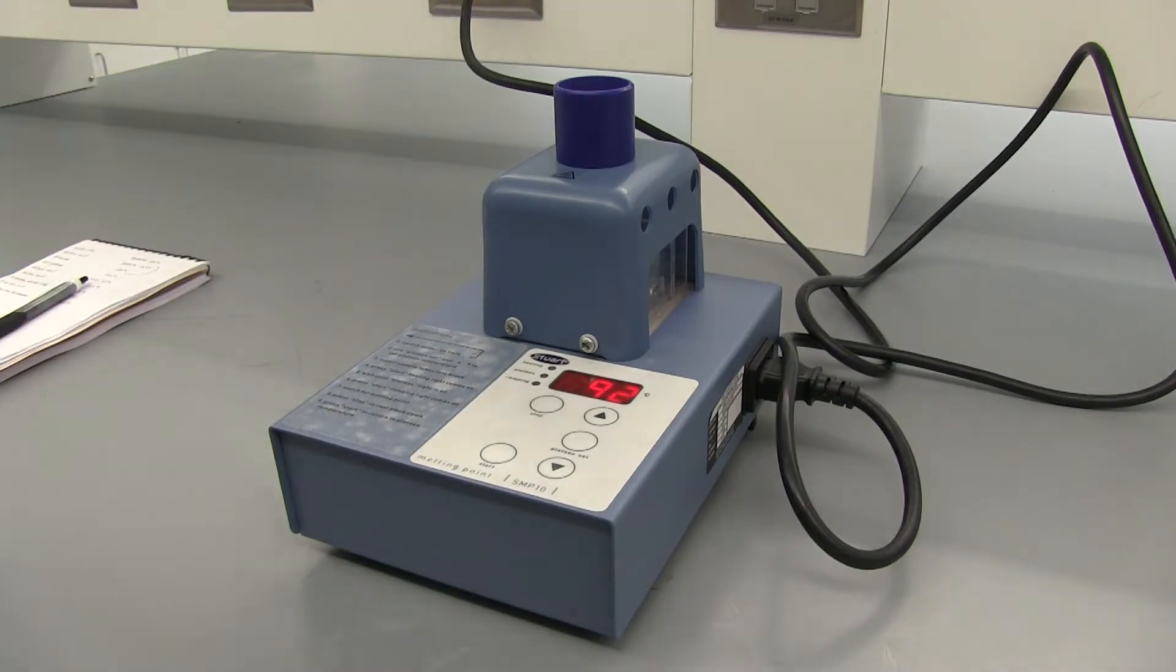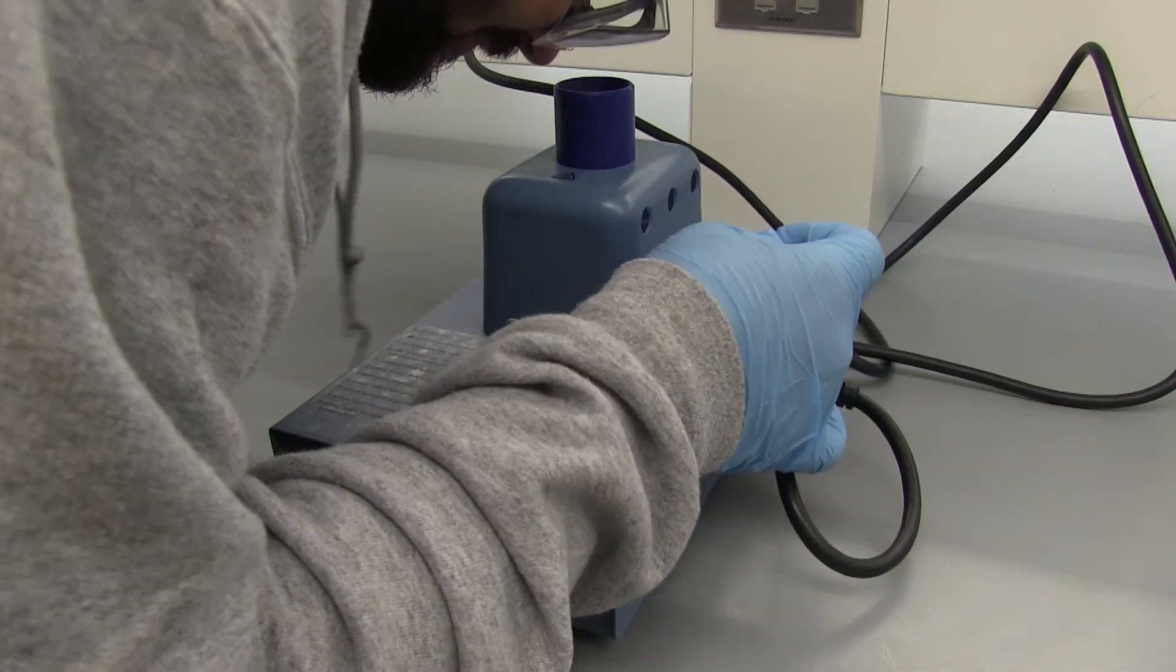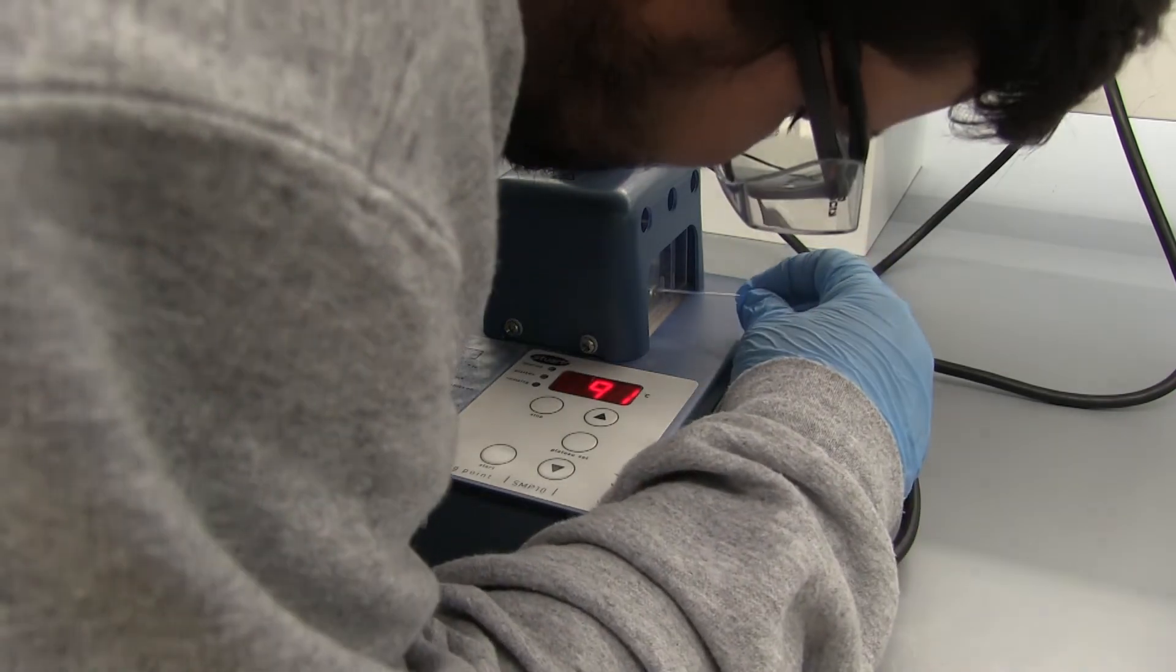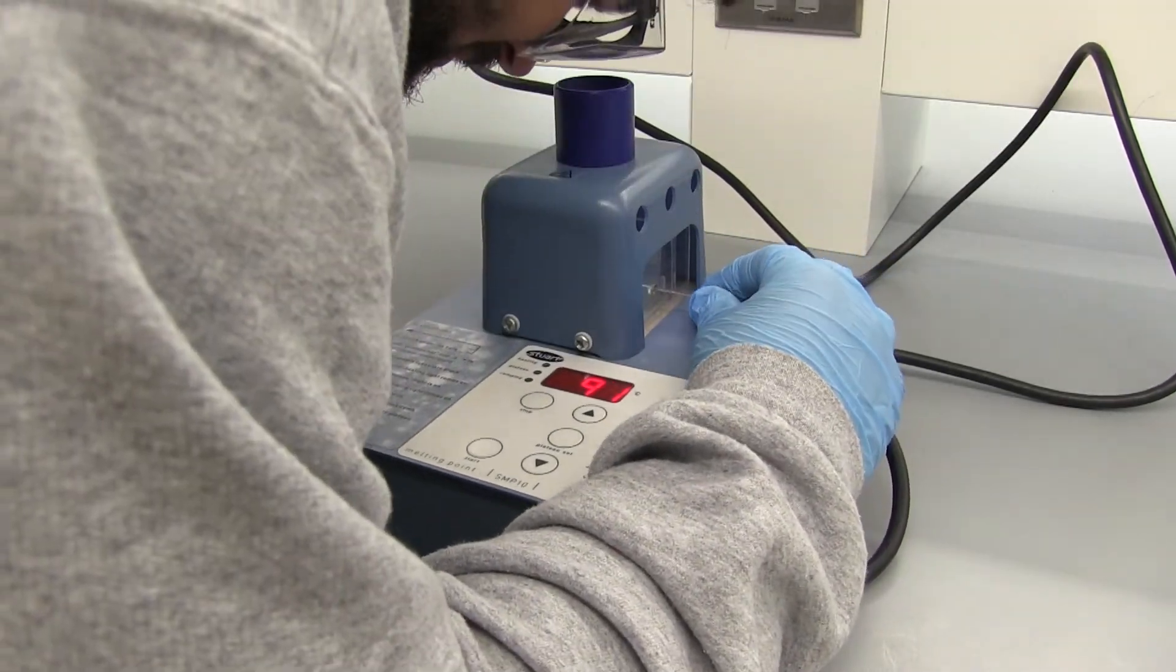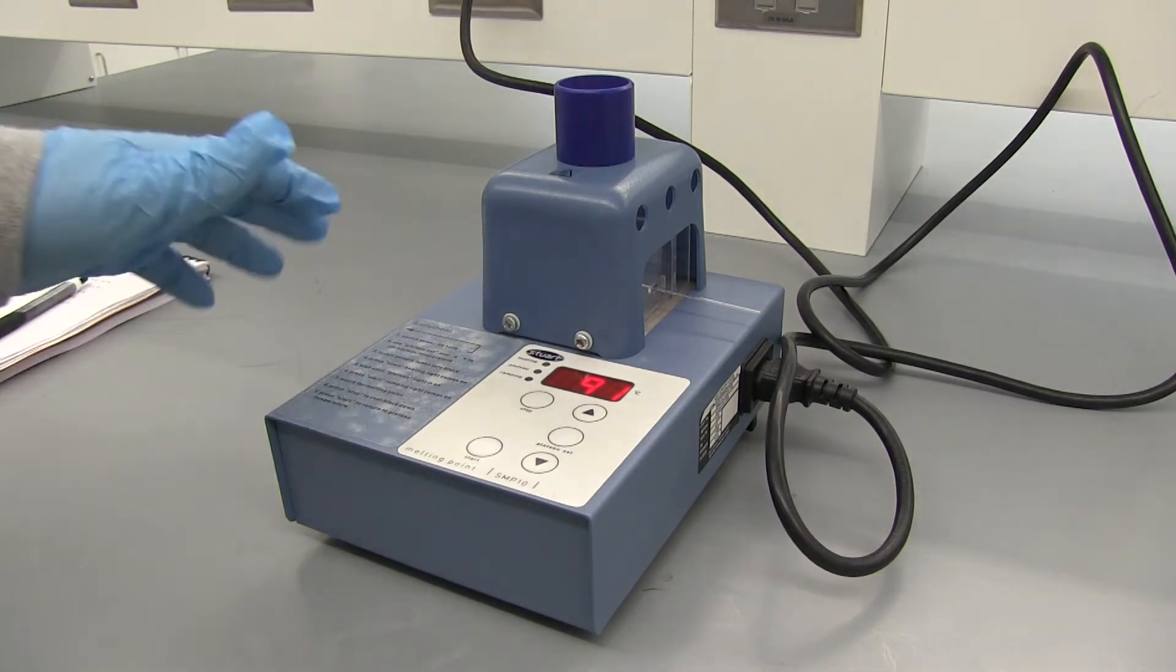Alright, so we waited for the temperature to come back down to about 90. So I'm going to go ahead and put this in and let it get to the 90 degrees temperature. So I'll just put it in and let it sit in there a little bit so it gets to 90 degrees, the same temperature as the heating block.